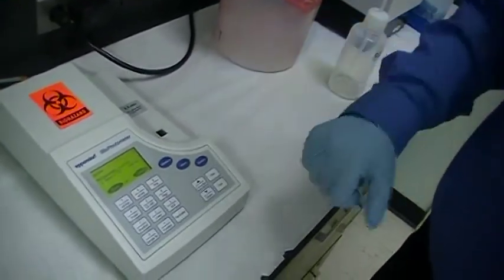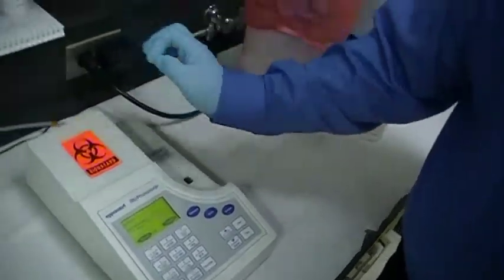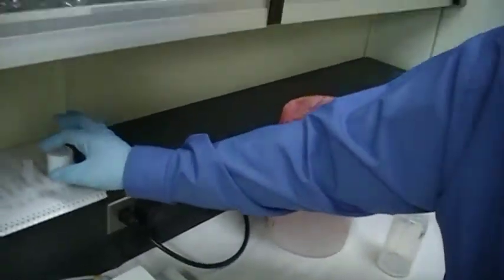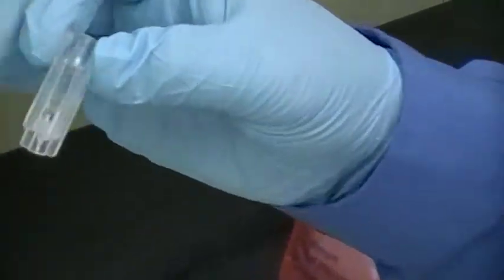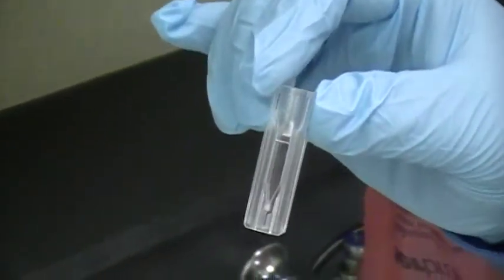And so as this is warming up, you take a cuvette like this. So this is a cuvette. So even though it should be clean, always assume that it's not clean. So you take this cuvette and you bring it to this cuvette cleaner.